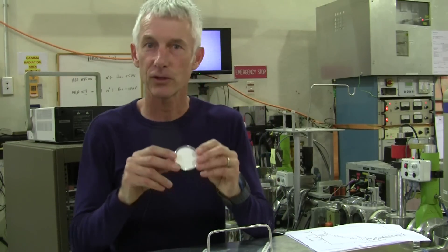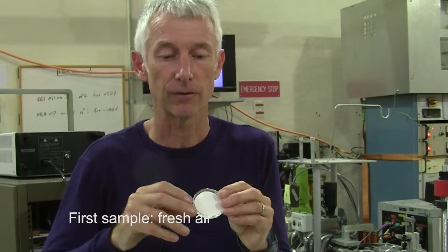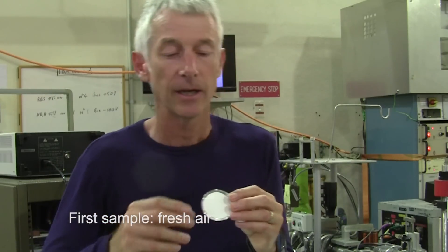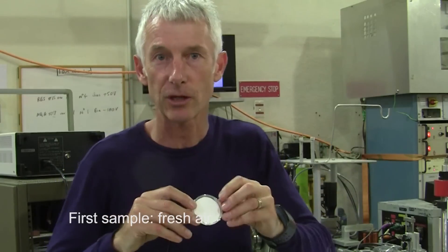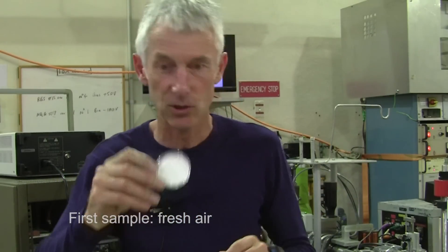This is the first sample that was collected. Even though it looks very clean, we'll still have a lot of background elements and sources of air particles on it — air particles like wind-blown sea salt. We'll have some nearby dust that's from the roads, from the traffic, and we'll still have other elements that we can detect with our machine.